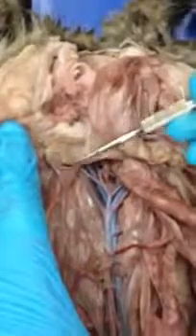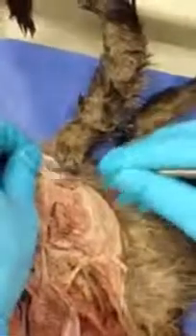This is a male cat, so right here we can see this little tube. You can see it coming around this way. Okay. So that is a vas deferens. You can also see it on the other side. Here's the other vas deferens. And those are coming from the testes. So here we have the scrotum of the male cat. And so if we were to look actually inside the scrotum, you could dissect this out and actually find the testis inside there.